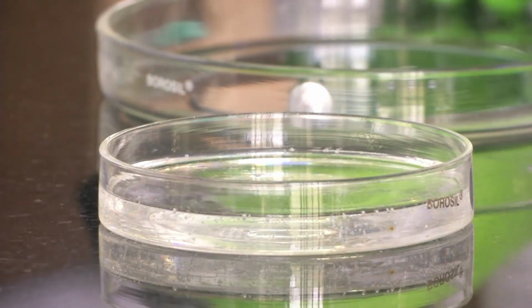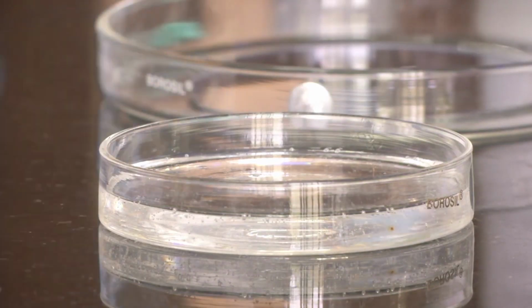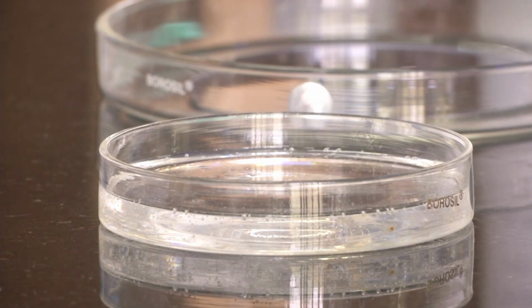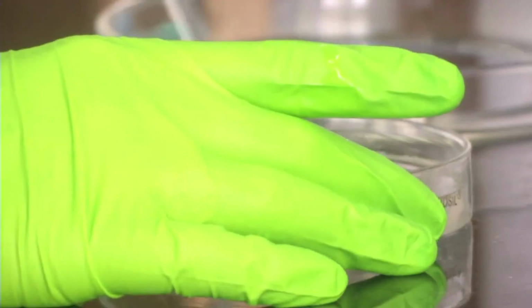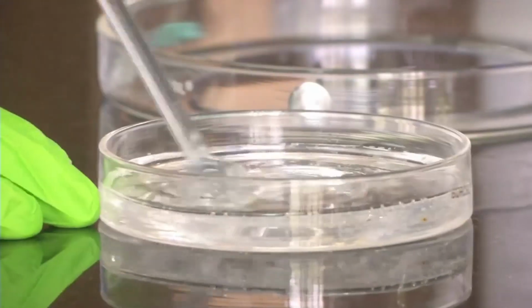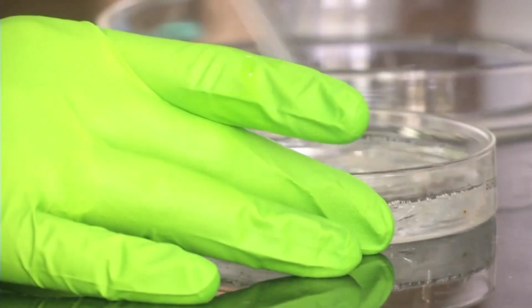Now, we have to mix it thoroughly as we have discussed. So, we use a glass stirrer. Why are we using glass? Glass is a very inert material, so it will not react with the chemicals. That is why most of these equipment like petri dishes are made of glass. This is very general knowledge, but many people don't know that. So that's why we are discussing that. So we are using a glass stirrer, as you can see. With the glass stirrer, we have to thoroughly stir the PDMS and curing agent. So I am stirring it. See, this is how we should stir it. We should stir it for almost 10 minutes.